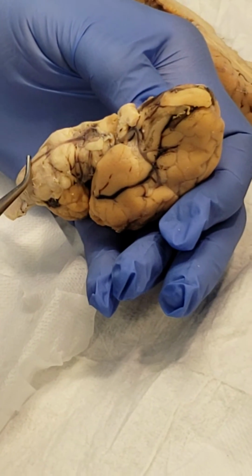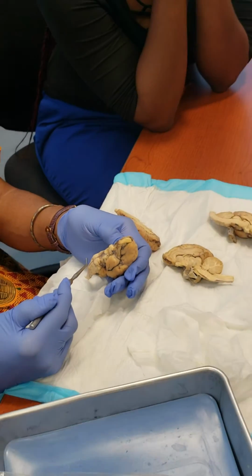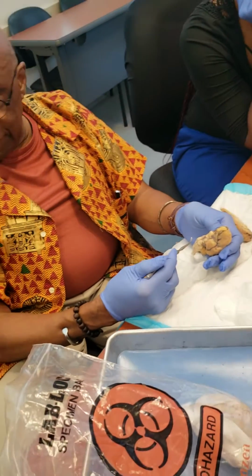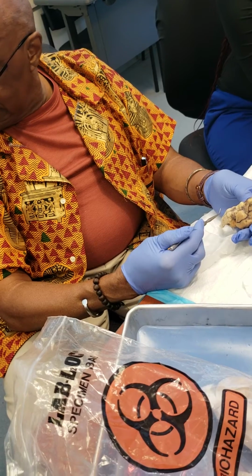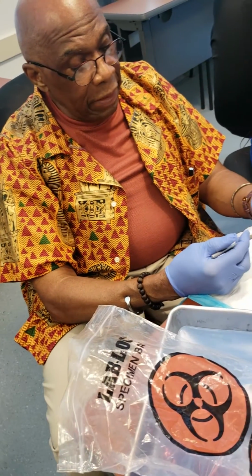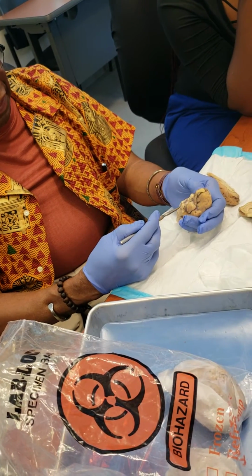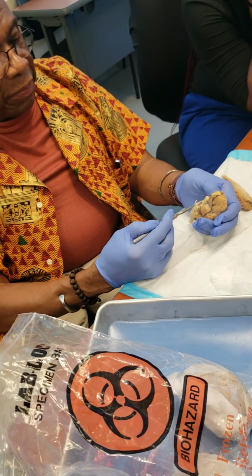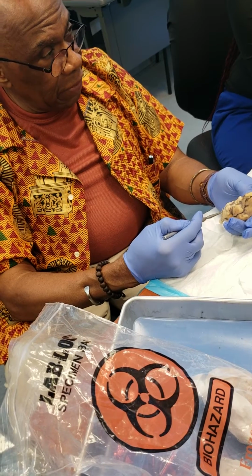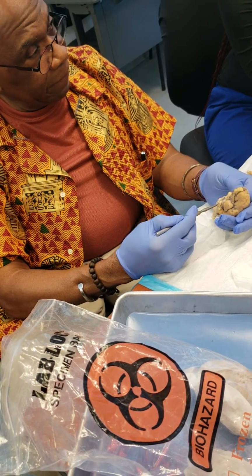Mr. Jackson, can you hold your breath for 5 minutes? Would you do that right quick for me? You can't do it, can you? Now, the diaphragm is a skeletal muscle, right? So why can't you hold it for 5 minutes? Because your heart needs oxygen, your brain needs oxygen. Well, not really. That is true in a way, but what I'm attempting to ask you is, the reason you can't do it is because the pons and the medulla control respiration and cardiovascular function. That's how you have to do it.